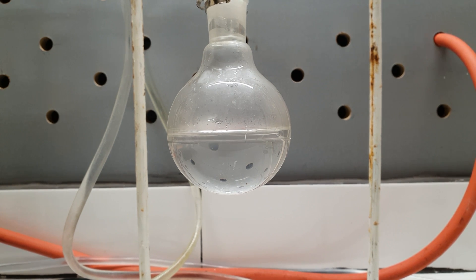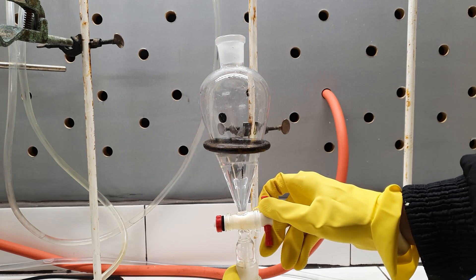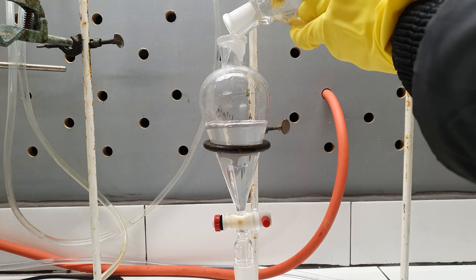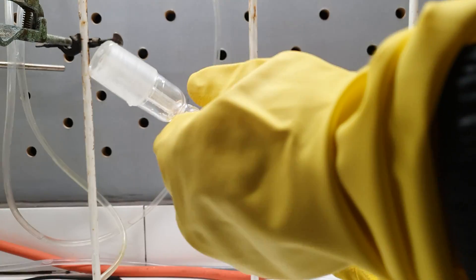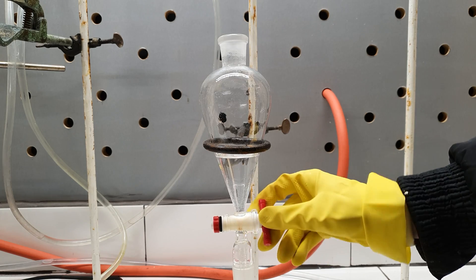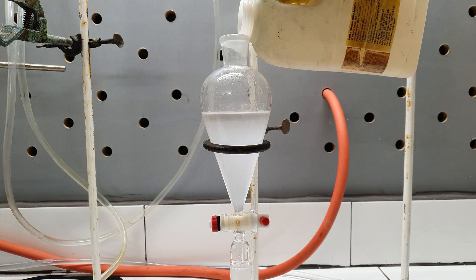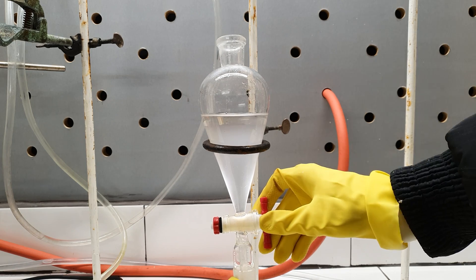At the end of the distillation I had about half the flask filled with bromobutane — the rest was water, so I had to separate it. To do this I used my separatory funnel. The lower organic layer was drained while the upper water layer was discarded. The organic layer was charged back into the funnel, and to it I added about 50 ml of distilled water. The funnel was capped, shaken, and vented to wash the bromobutane. The lower layer was again drained off and the water layer discarded.